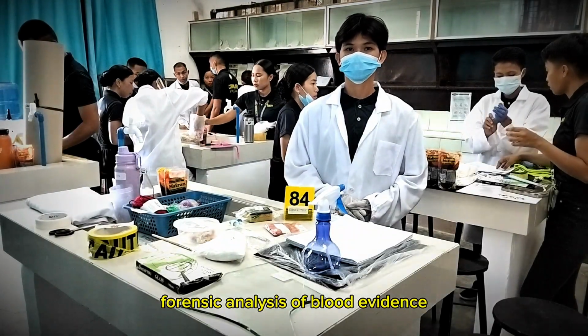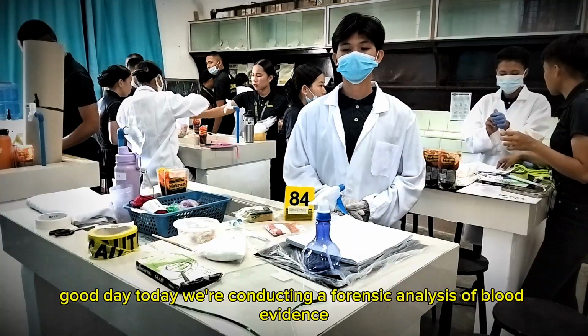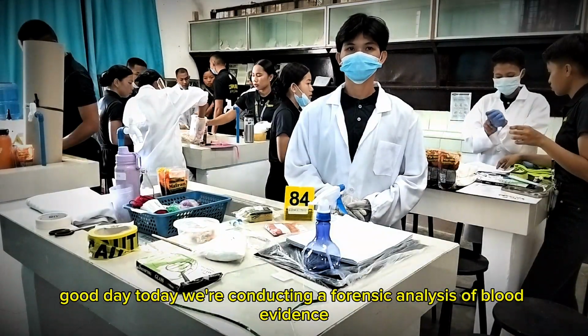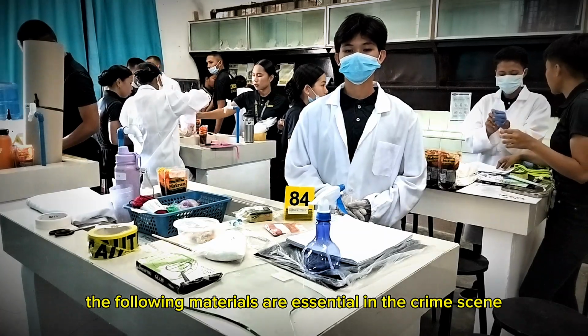Forensic analysis of blood evidence. Introduction of materials. Good day. Today, we're conducting a forensic analysis of blood evidence. The following materials are essential in the crime scene.